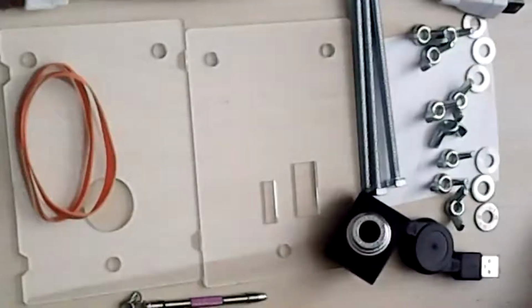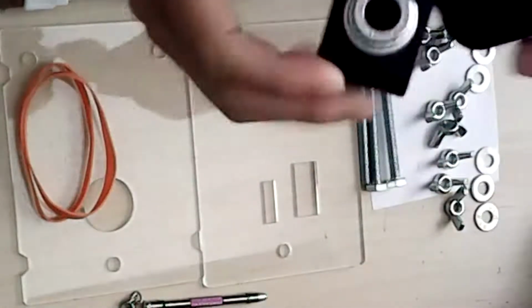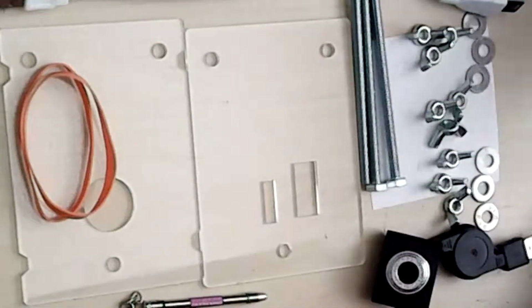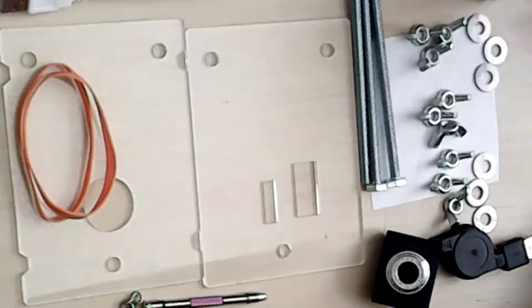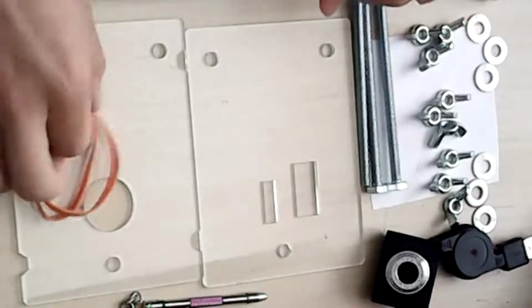So I can just give a quick intro of the materials that you'll be needing, and you'll get all of these materials in the kit, with the exception of maybe this piece of paper and some tape. So let's get started. What we have here, you'll see a webcam. We'll convert this to the thing that you'll use as the microscope. And then we have a couple washers, 6 to be exact, and a couple wing nuts. We need 9 wing nuts, so 3 more than the washers that we have. And we also have 3 long bolts and then 2 stages.